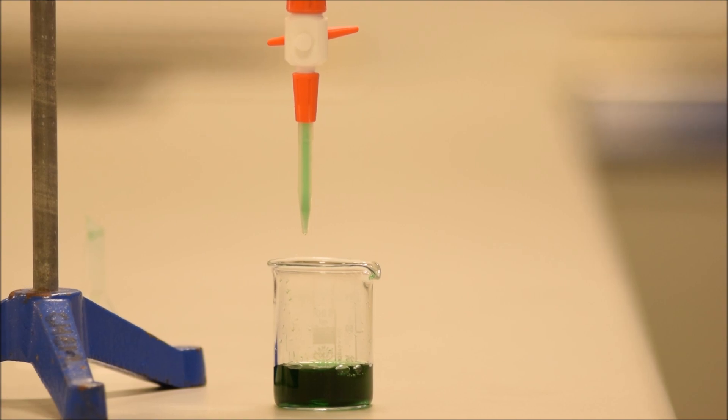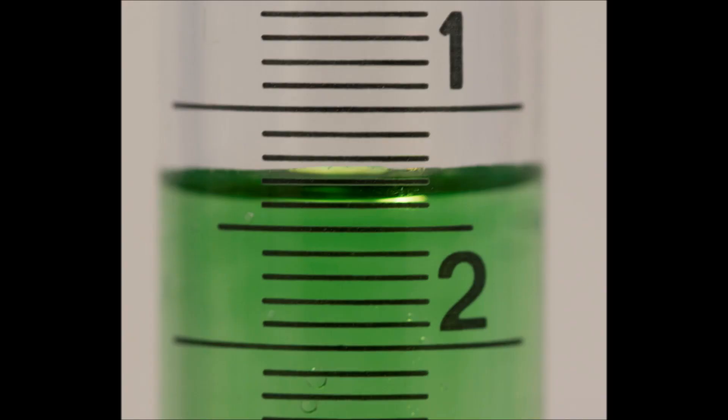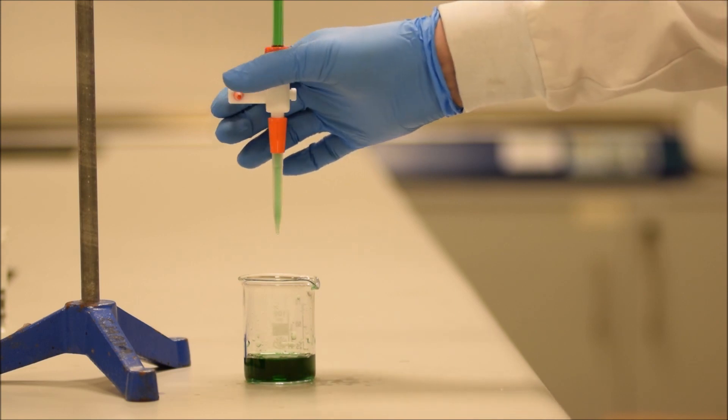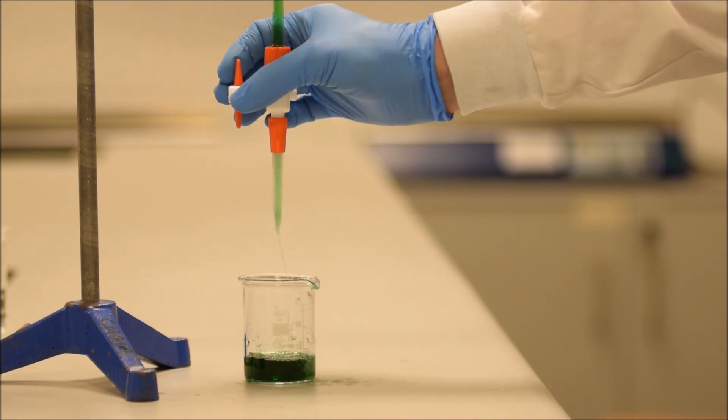In any event, we don't want to have it lined up at zero. So if you look at our scale, we can see we have it at roughly 1.38 milliliters. We're going to allow some amount to flow out into a flask, and then we're going to have a look at where the scale is then.